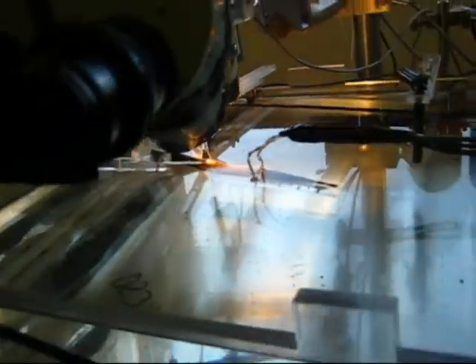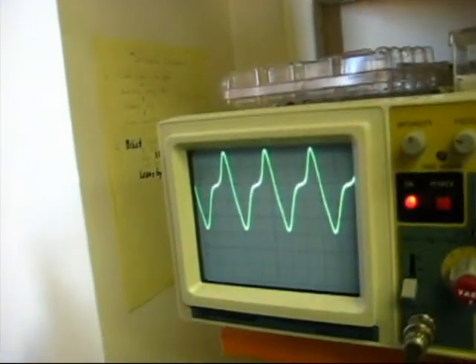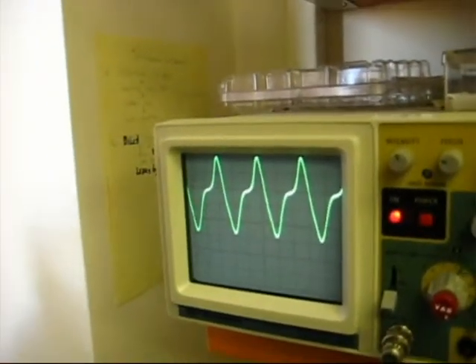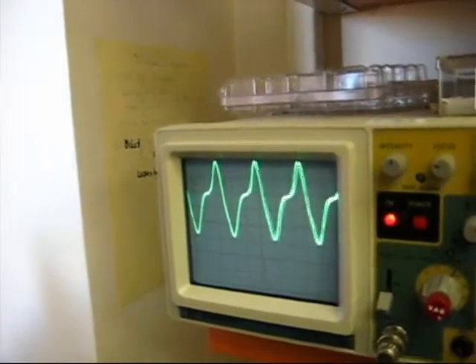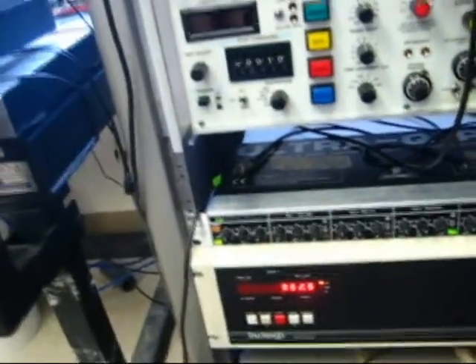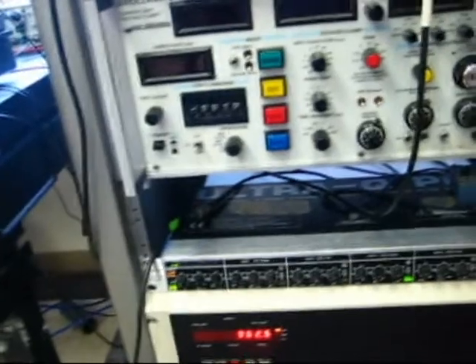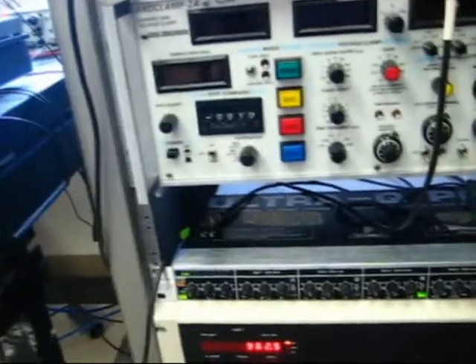And you have a bunch of electrodes around the tank to stimulate and record. And here on the oscilloscope you can see the EOD of the fish. That's the electrical field that it's producing around its body. So we're gonna go down in the brain with the electrode. The noise you hear is the voltage trace from my recording electrode that's hooked up to a speaker, so that spikes will be heard as clicks on the speaker.